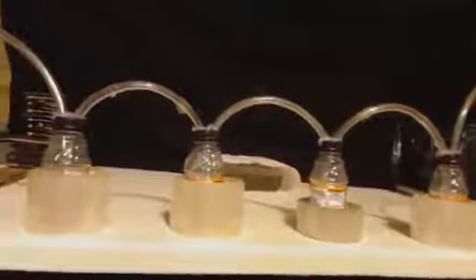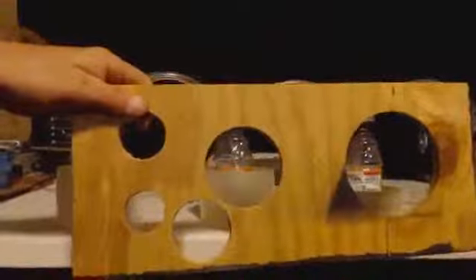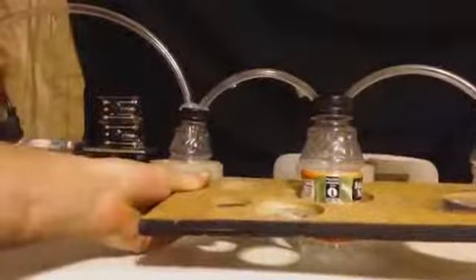Another way you can do that is you can build something like a test tube stand. If you're familiar with that, you know it's got a top and bottom. They've got holes in them. Find the hole that's right for your bottle. You don't want it too snug where you can't get the bottle in and out, but you don't want it too big where it's going to be falling all over the place. So you cut your holes. How many holes you have depends on how many bottles you have in your bubbler. If you have two, you'd make two holes.